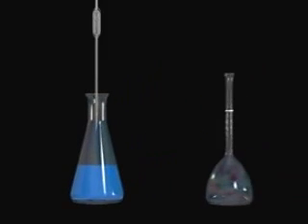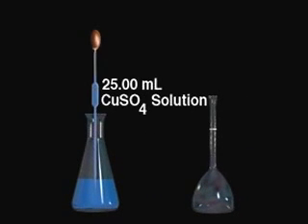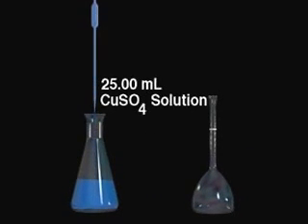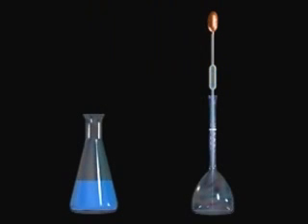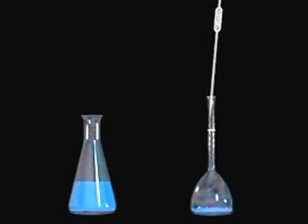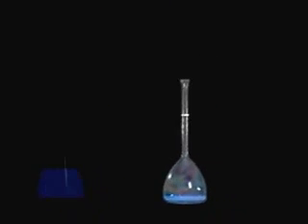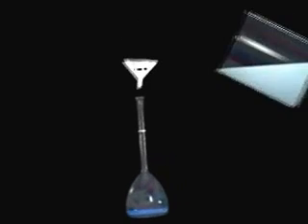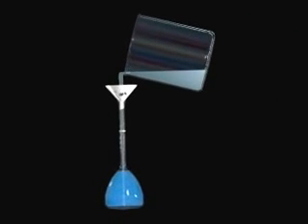We first withdraw precisely 25 milliliters of the stock solution with a 25 milliliter pipette. This amount of stock solution is then added to the 250 milliliter volumetric flask.